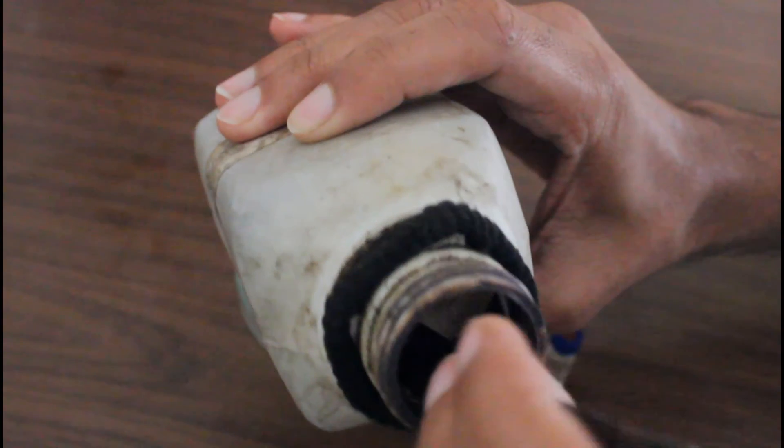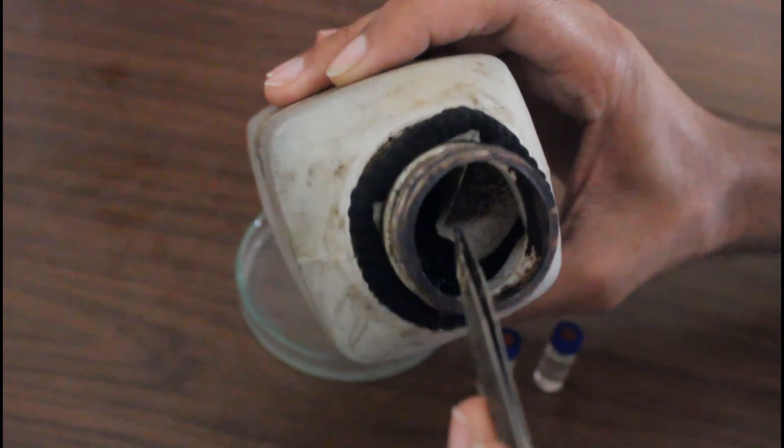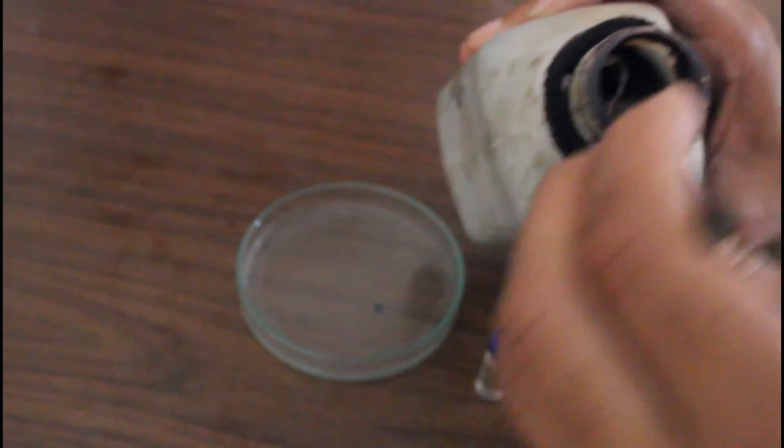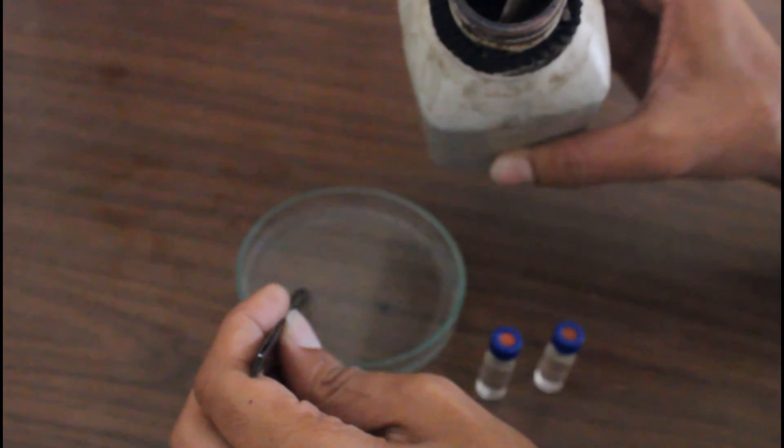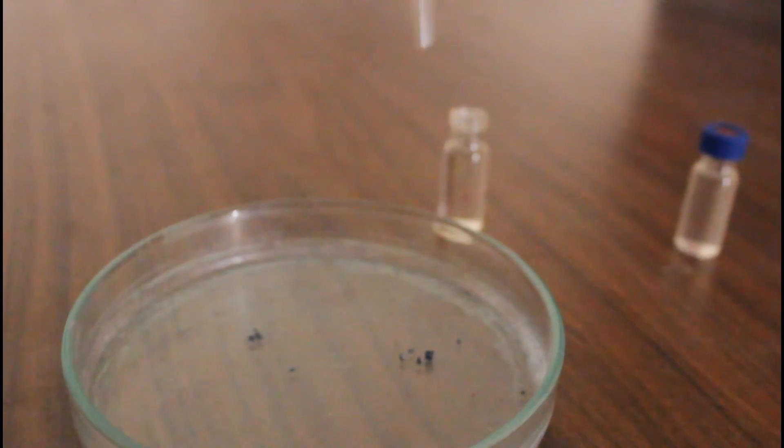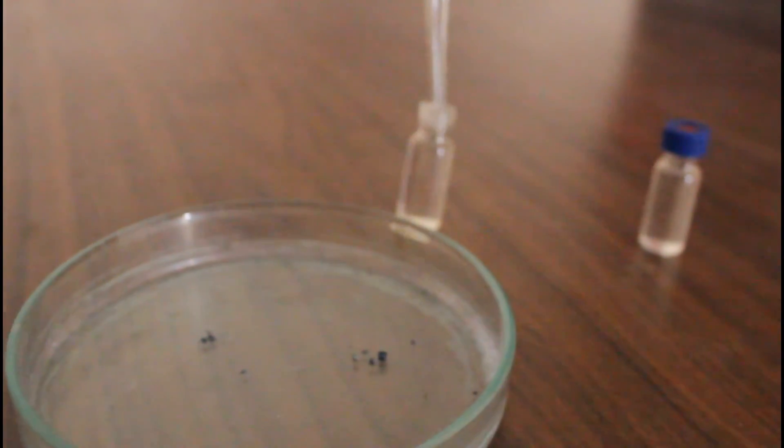Okay, now I will test the potassium permanganate solubility into the samples. As you know the potassium permanganate is quite soluble in water and also in alcohols and ketones. So let us see if it dissolves or reacts with the potassium permanganate.